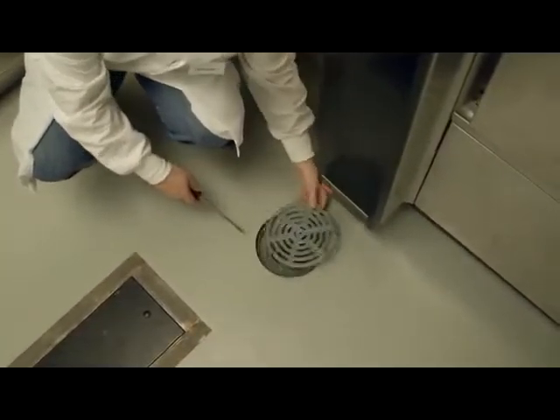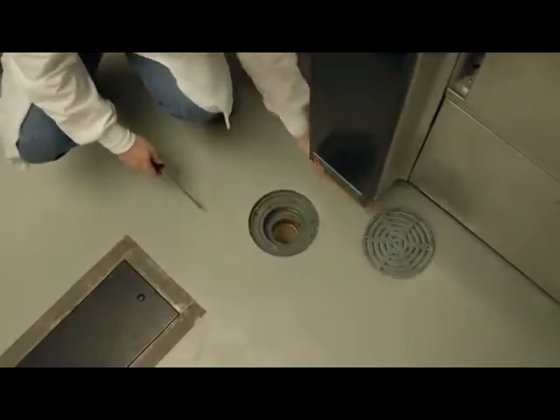Remove floor drain grid. Put latex gloves on hands.